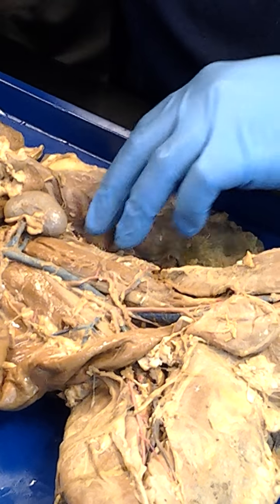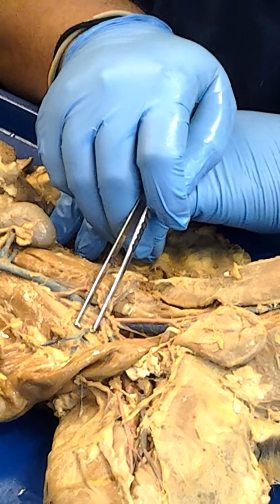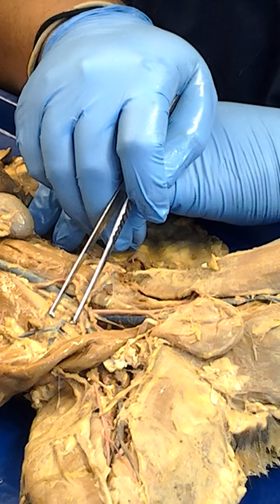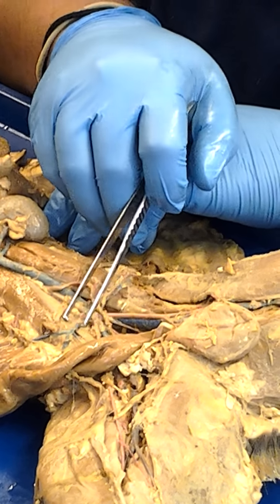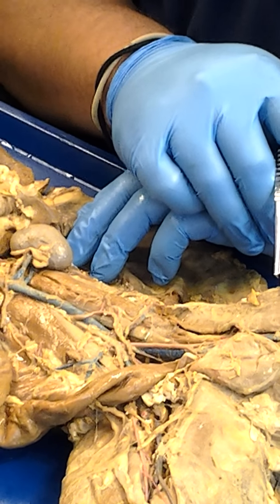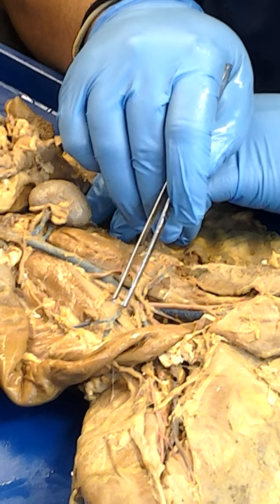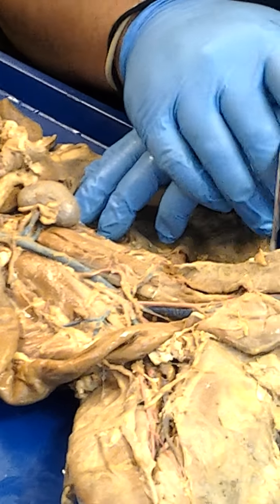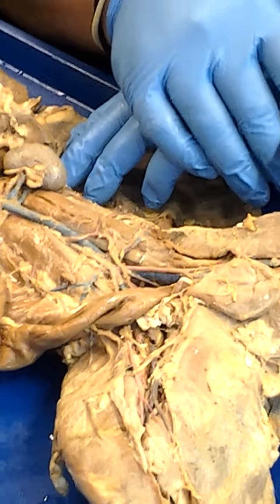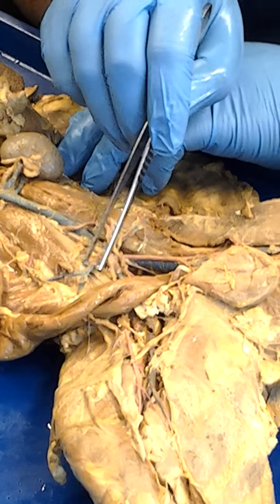We head downwards here a little bit. We'll see here that we have a blood vessel that comes off of the side here. This blood vessel right here is not the same as the lumbar vein in the humans. Does anyone know what the name of this is? No. No one knows what this blood vessel name is right here. It happens to be in the lumbar region, but also in the iliac region. Iliolumbar? Fantastic. The iliolumbar. So that's what that is. That's the iliolumbar right there.